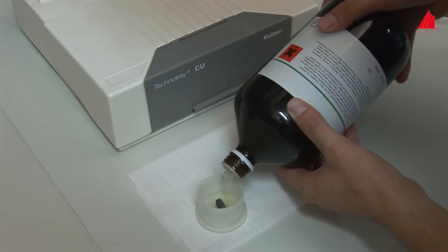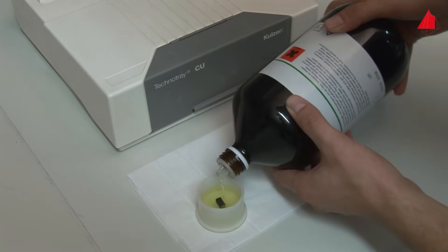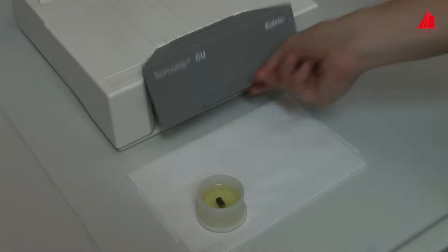Then, he pours liquid resin into the mould. A thin layer of grease at the inner surface of the mould acts as a release agent. This ensures that the cured resin can later be released easily from the mould.